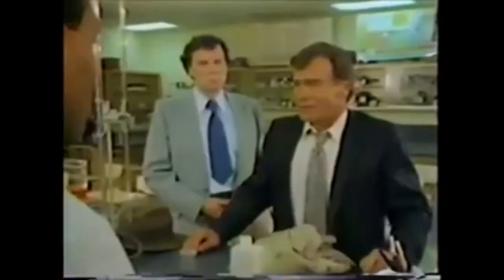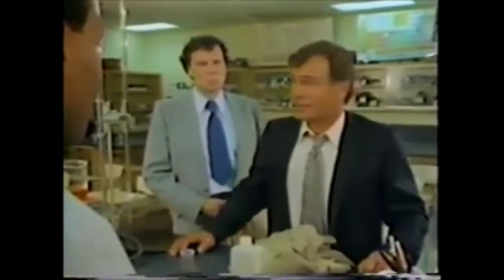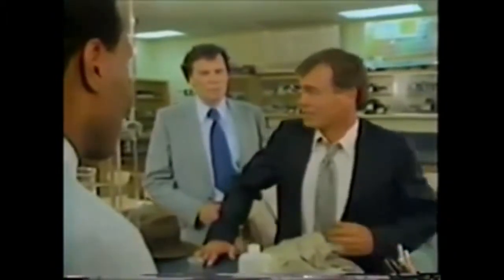I just can't figure it. You and your students are doing everything right. Everything? Your lab is clean and well organized. I don't get it. How could there have been an accident here? The lab accident here at Jefferson High.